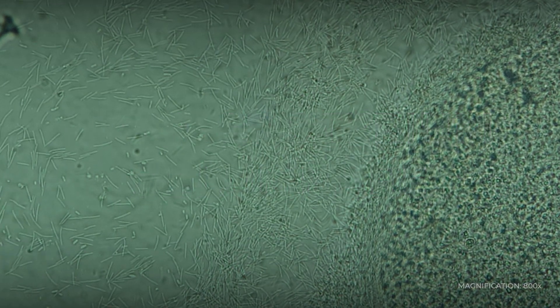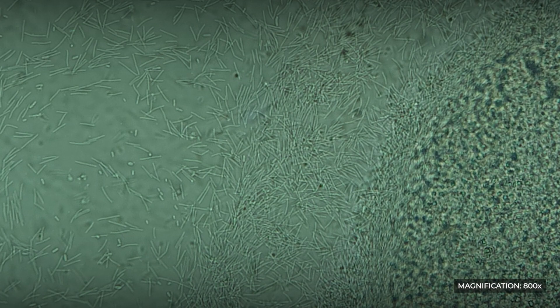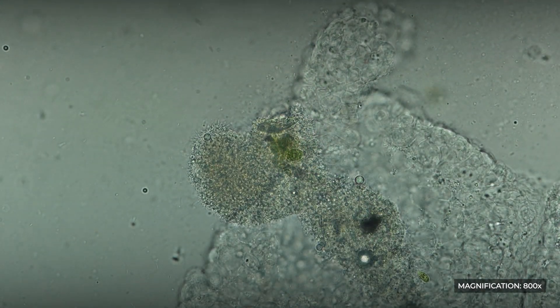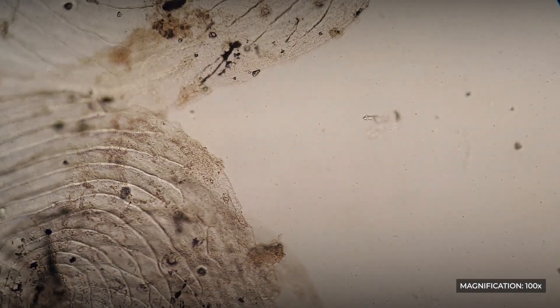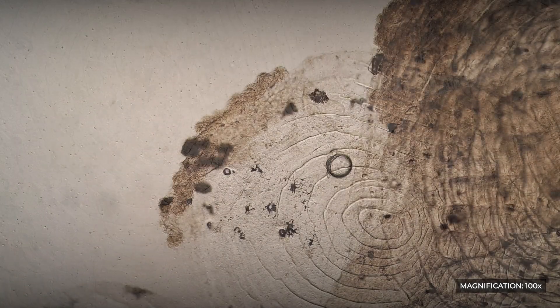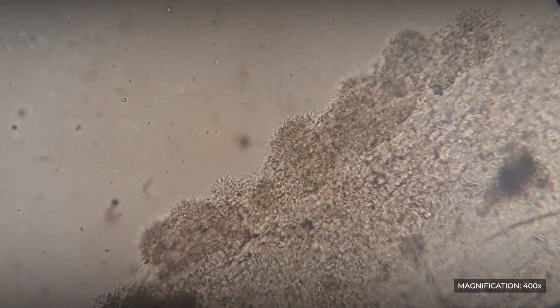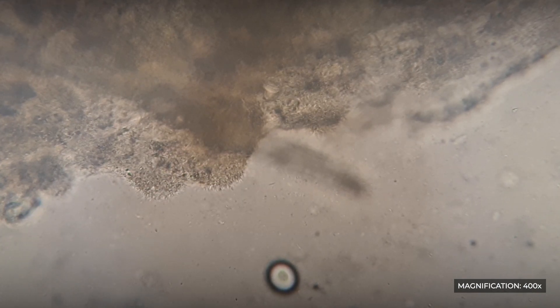Flavobacterium columnaris is one of the few species of pathogenic bacteria that can be identified using a microscope. This large, gram-negative, rod-shaped bacterium forms colonies on the body of fish, ranging in color from white to yellow-orange, due to the pigment contained within the cells. In a sample taken from the body of an infected fish, individual scales and normal transparent mucus can be seen. Special attention should be paid to the yellow-orange film surrounding the scales, which forms bumps. At high magnification, we can observe how the undulating, bending movements of individual cells in the colony create a wave-like motion, which is the hallmark of this type of bacteria, making accurate identification relatively easy.